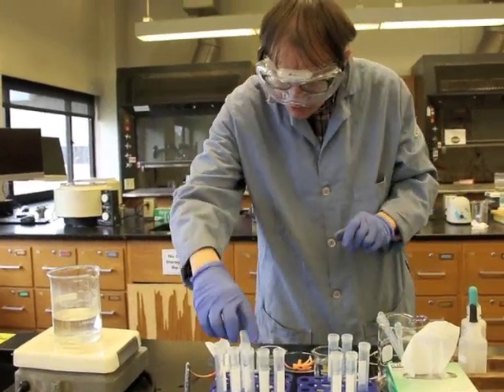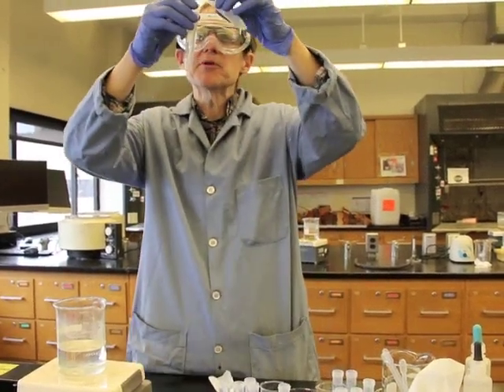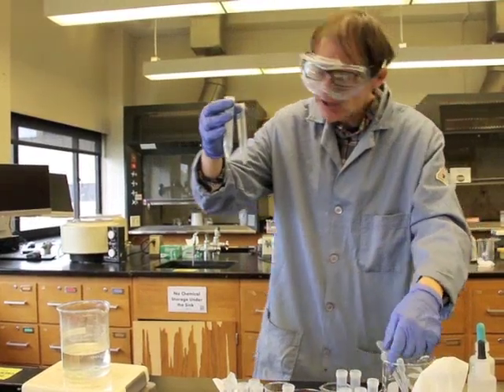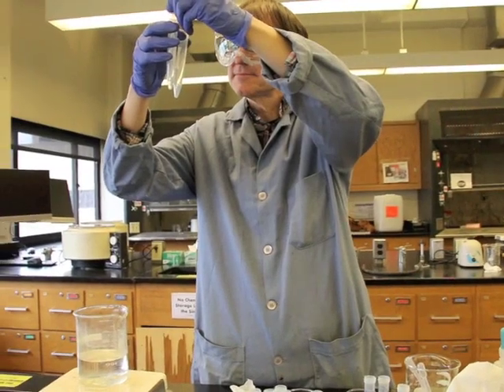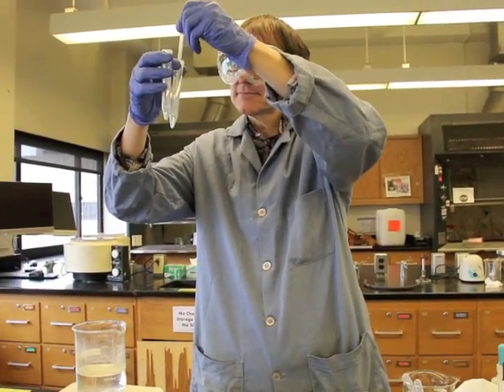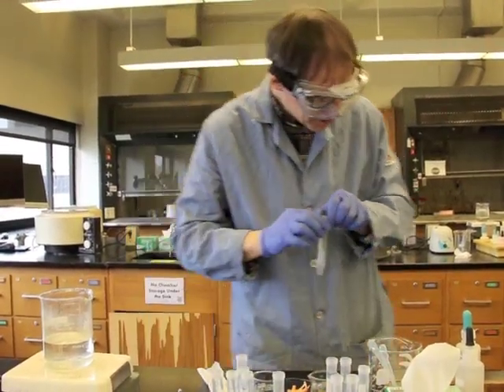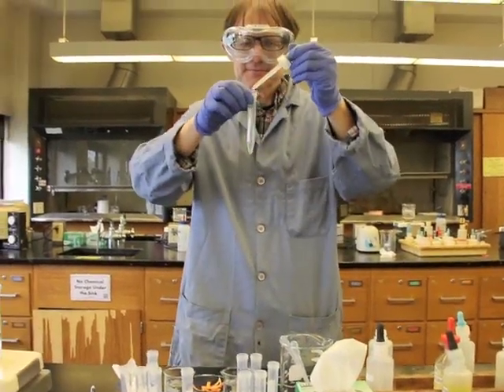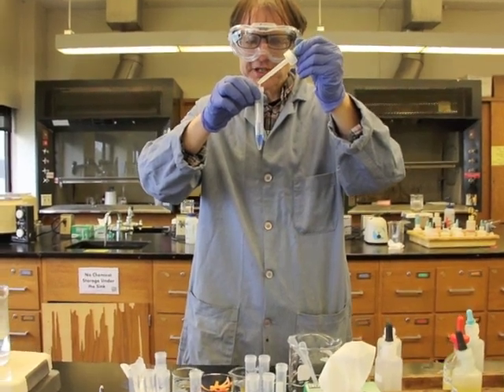Now, what about the supernatant for our unknown? We don't know whether copper's in this one, so I'm going to pour half of this one. Now, actually, maybe I learned from my previous lesson that it's a little easier just to use a transfer pipette. Okay. And now we're going to add ammonium hydroxide to the first one. And what do we see? Dark blue again, deep blue, beautiful blue color.